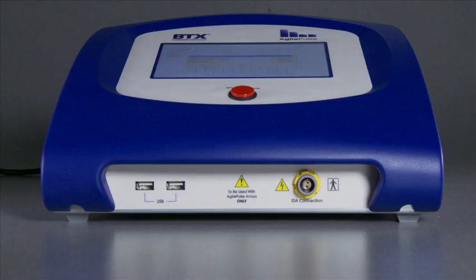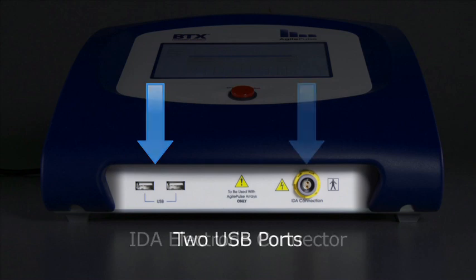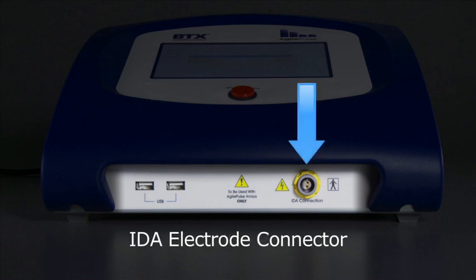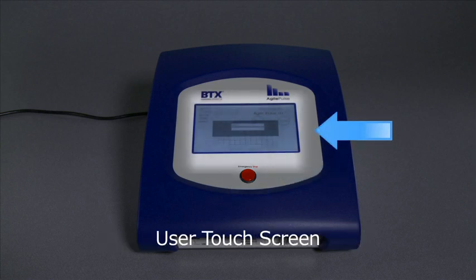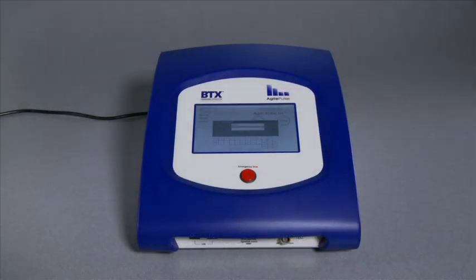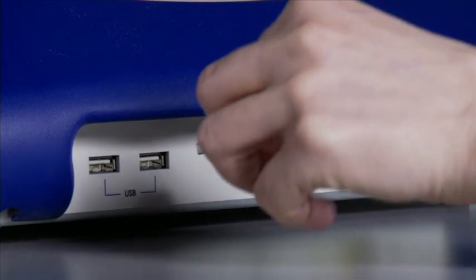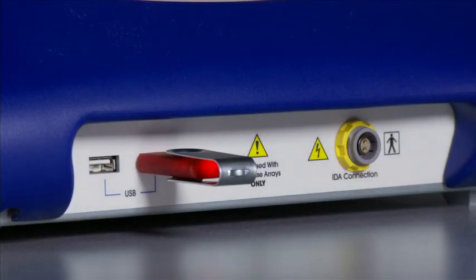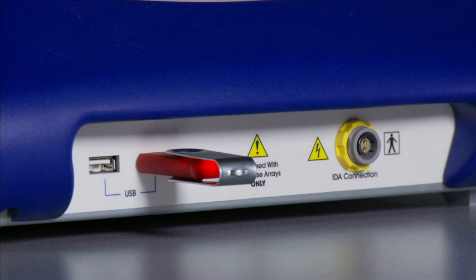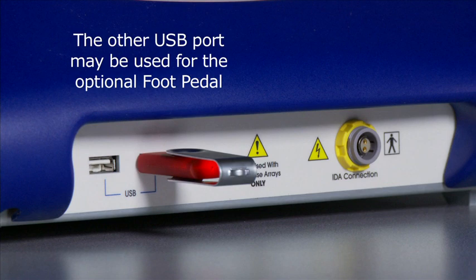The following can be found on the front panel: two USB ports, the IDA electrode connector, the emergency stop button switch, and the user touch screen. All user inputs are entered via the touch screen. One USB port can be used for a memory key, and the data logs that result from a vaccination are automatically stored on the key if one is inserted. The other USB port may be used for the optional foot pedal.